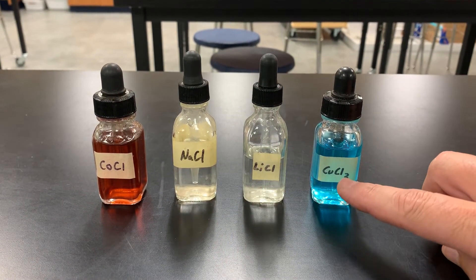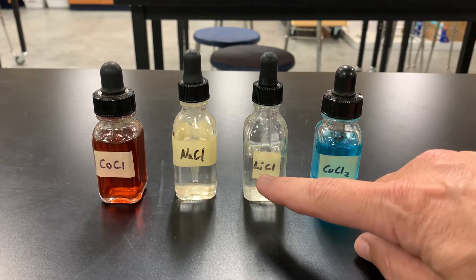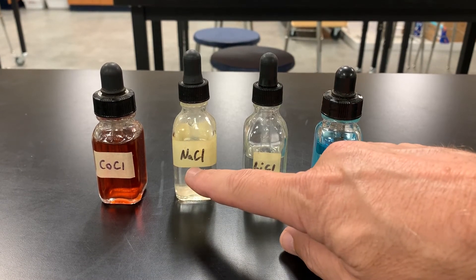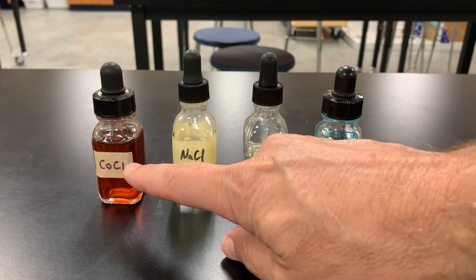Here is copper chloride, lithium chloride, sodium chloride, and cobalt chloride.